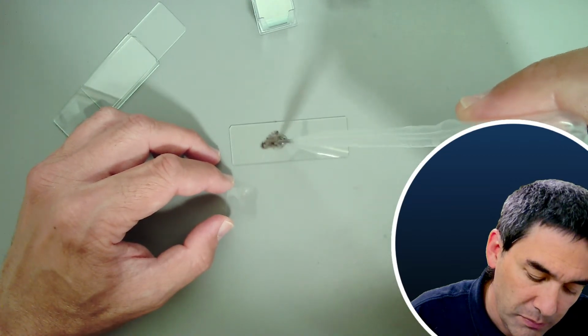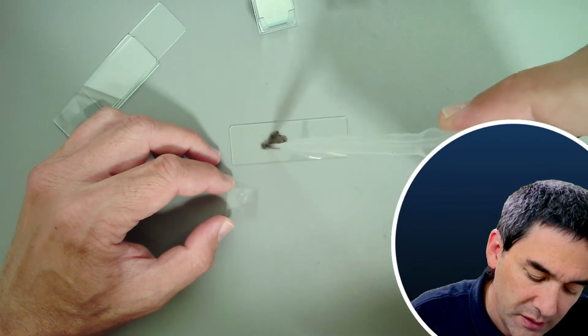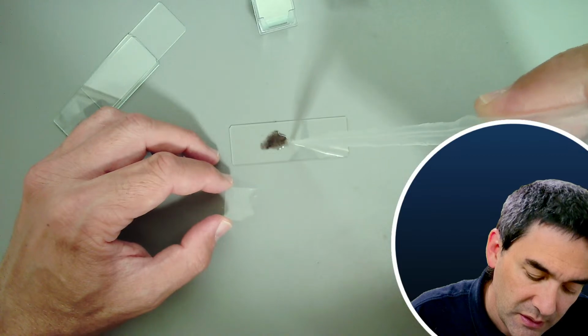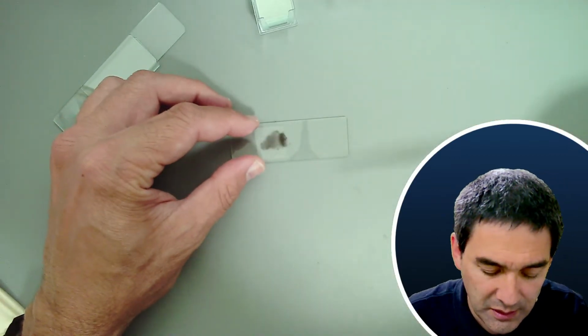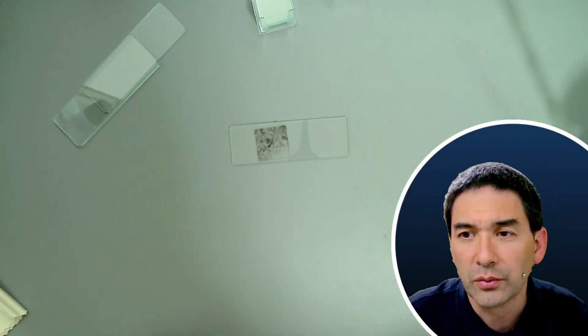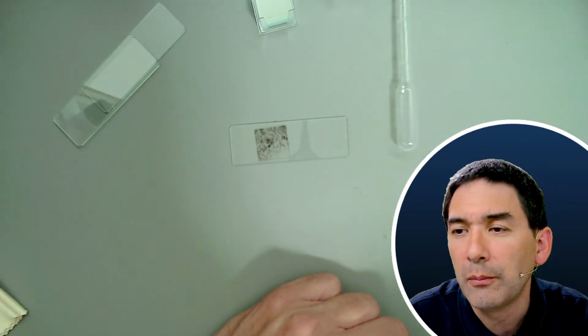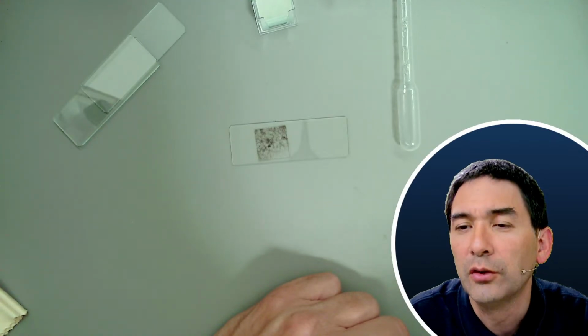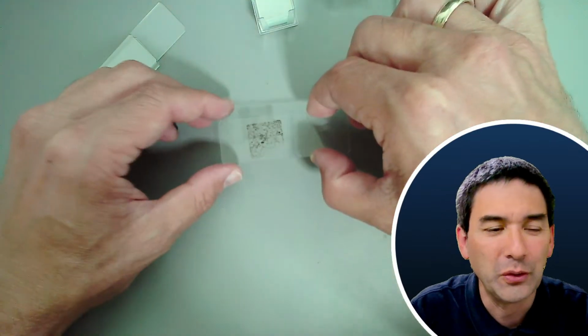Again, please do not be overly disappointed. It's not the most exciting sample, okay? But still, let's put it like this. Yeah, and I think we're ready. We're ready to go. I'm always going to also have a short look, hoping that I'm not going to overlook anything.